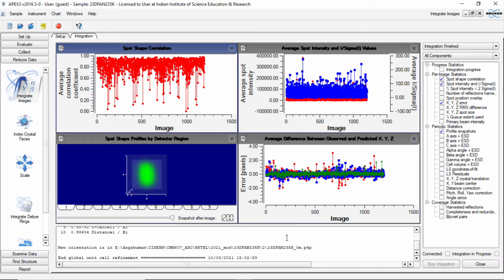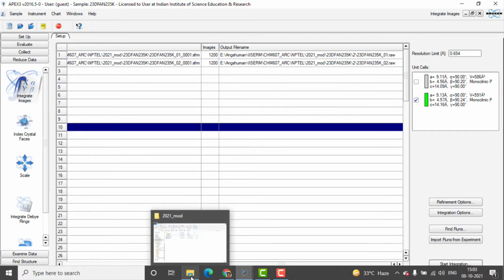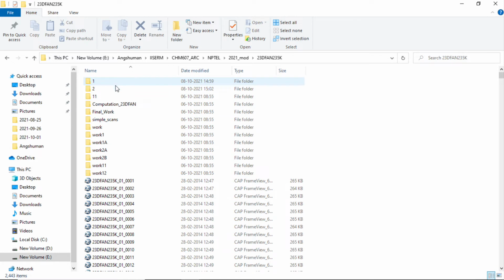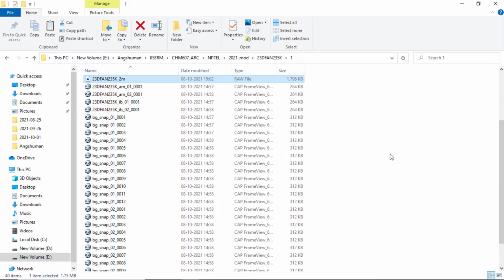So now it has completed the integration of the second data set as well. So we just close this, and what we need is now to go to the folder to take the raw file of 2 with a name. Instead of 0m we write it as 2m, and take that raw file in the folder 1, because we will read the folder 1 in the next step and then add this data at an appropriate point.